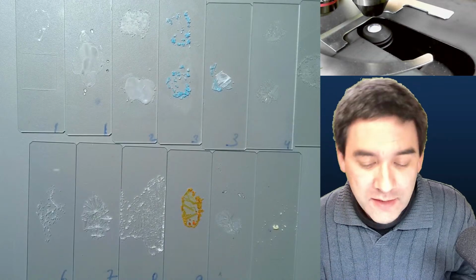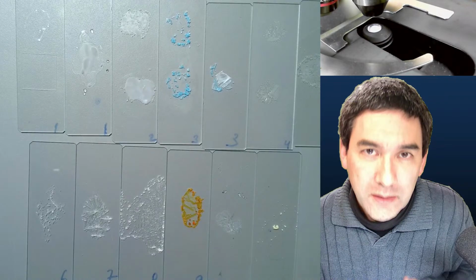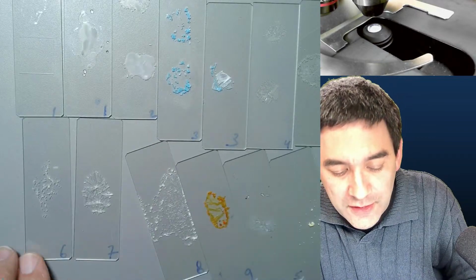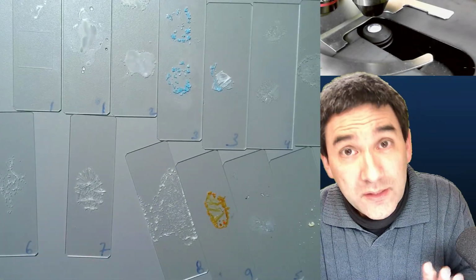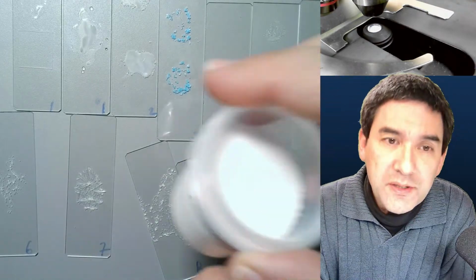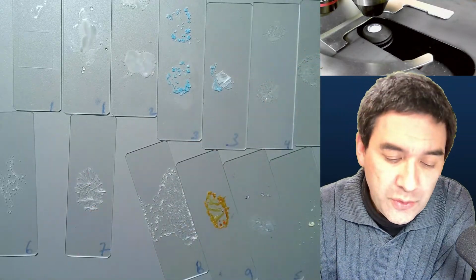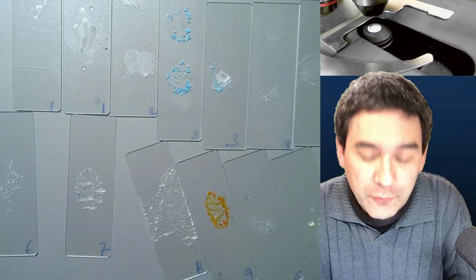So what I'm going to do now is give a little bit of background information. If you want to make crystals for microscopy, essentially all you do is take a little bit of solvent. In many cases water is enough. In some cases alcohol is also fine, and you mix a little bit of whatever substance you want to use with the solvent, and you spread it. It starts to dissolve, and you allow the water to evaporate, and then with a little bit of luck and a little bit of patience, you'll have crystals forming.